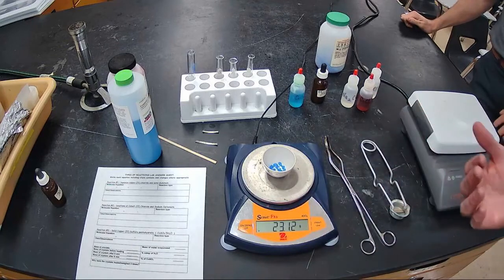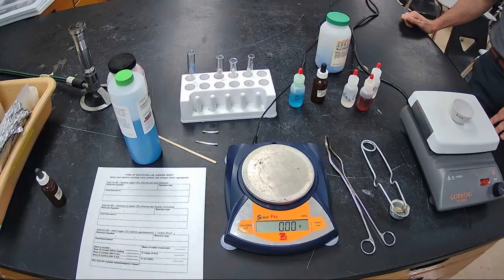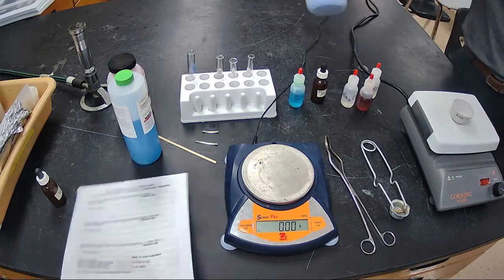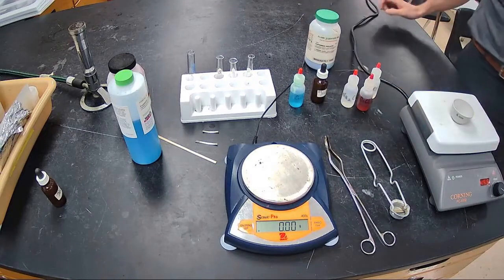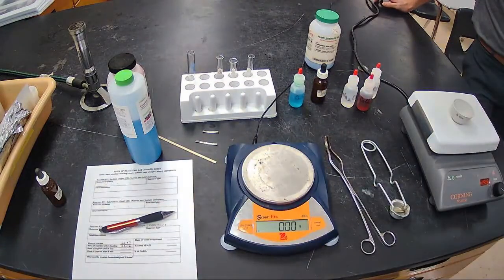You can see on here, we're now going to start heating it. All right, we'll set it on the hot plate, and I'll start my watch. We're going to heat it for 5 minutes, and we'll come back to that one. Why are we heating that, Mr. Furiosi? Well, I definitely do see a blue color in it. I can already start to hear it fizzing a little bit, and just from the formula itself, we can see that it says copper 2 sulfate pentahydrate. So kind of right here, you can see the pentahydrate a little bit. So I wonder what's going to happen when I heat something that appears to have water in it. It's a mystery. Good question. Yeah. So you can hear it fizzing.